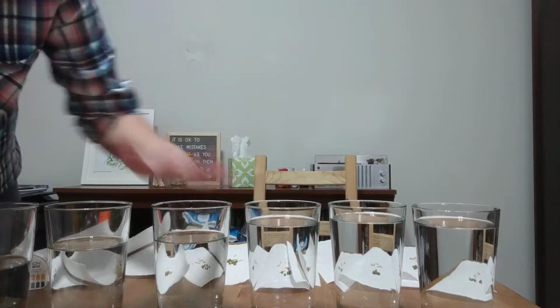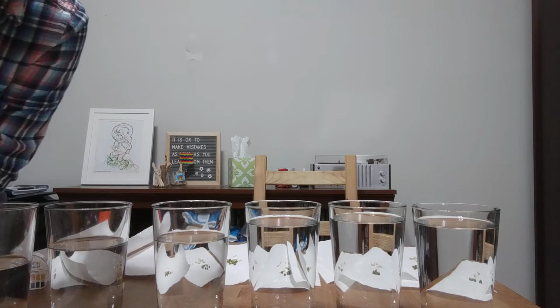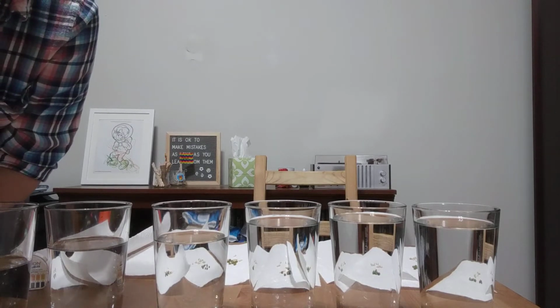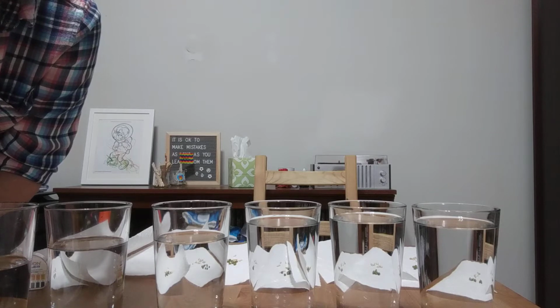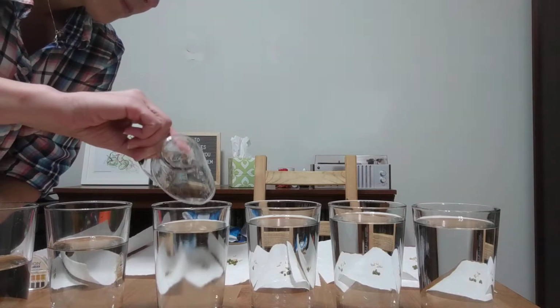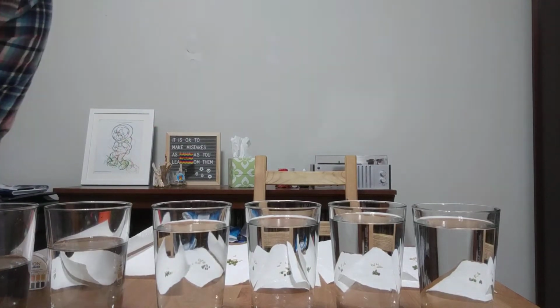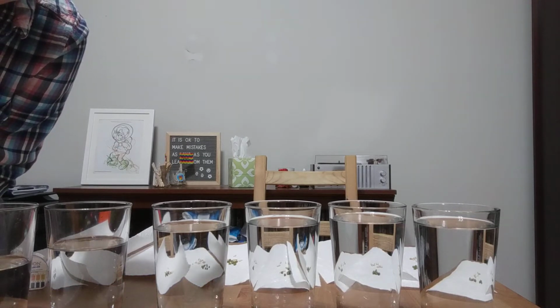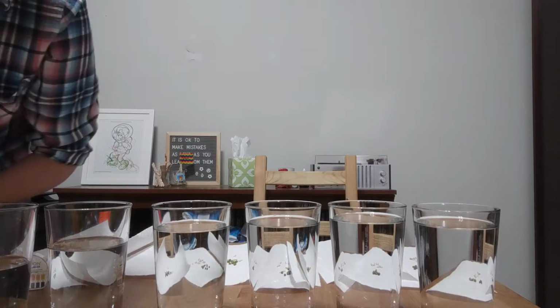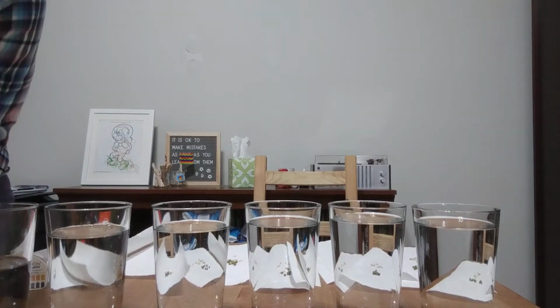This one is going to need 50 because it has 350 mLs of water. All right, it's a good thing I put some paper towels down because I'm having to pour out a little bit of vinegar again. All right, so there's 50. This one needs 100, so for this one I'm going to do 60 and then I'll do 40 again. All right, that's 60, and now we'll do 40.